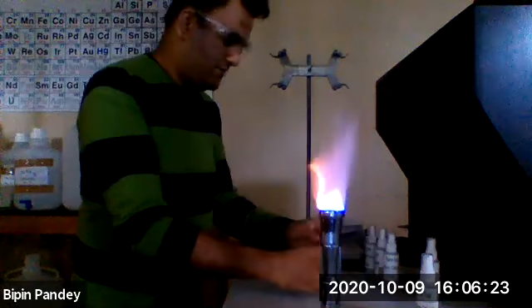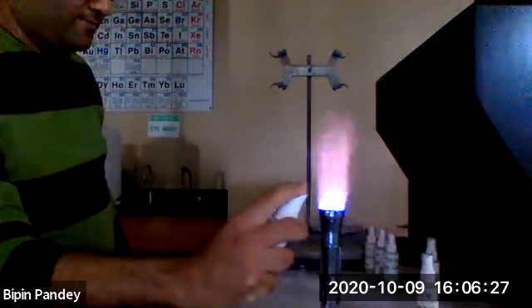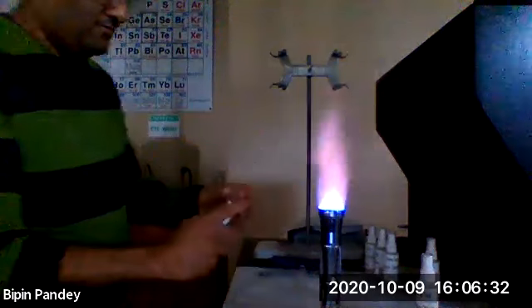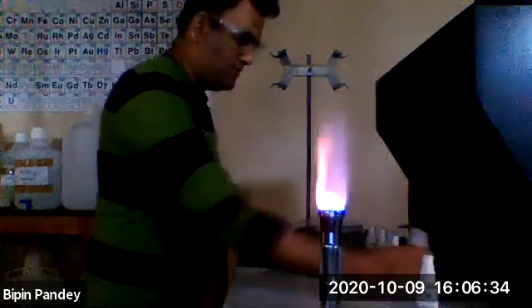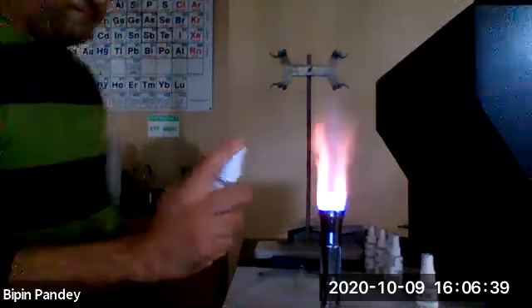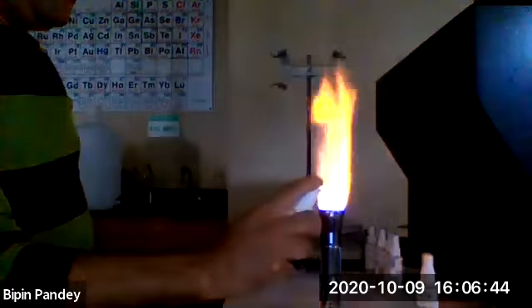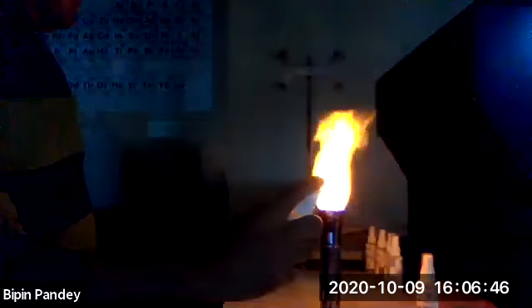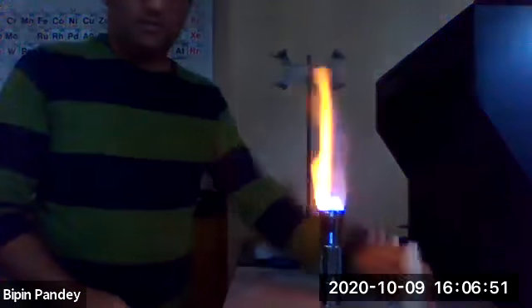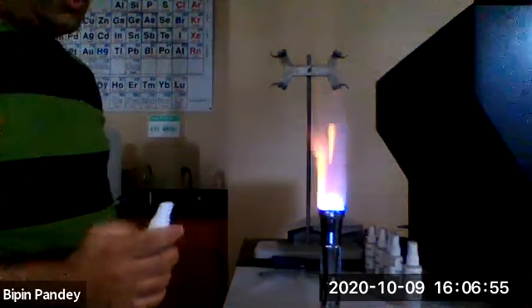Fourth one I have is potassium. Fifth one I have is sodium. Sixth one I have is strontium.